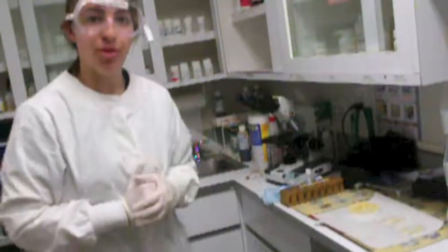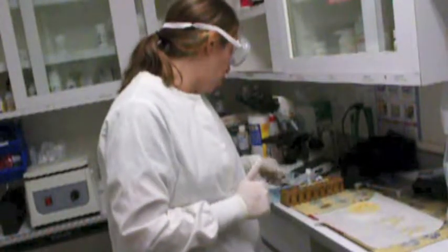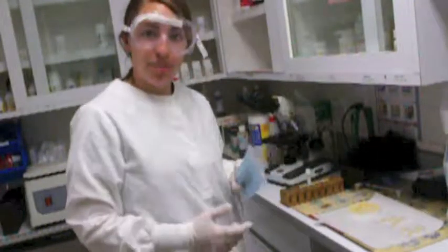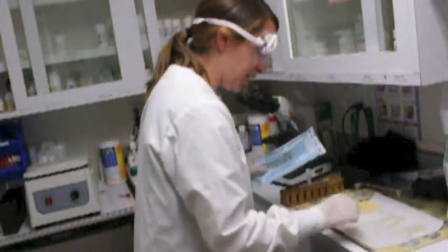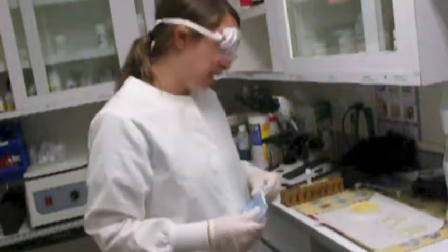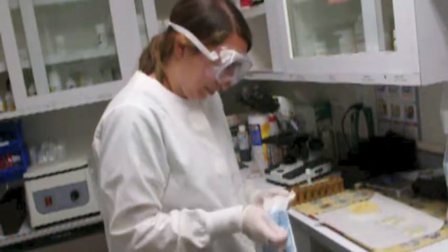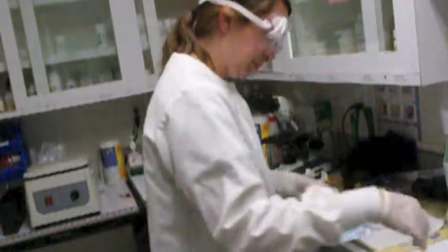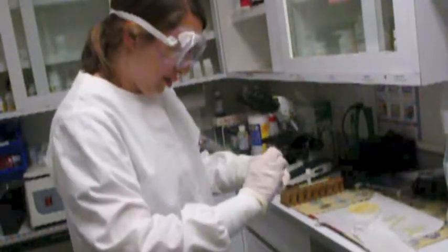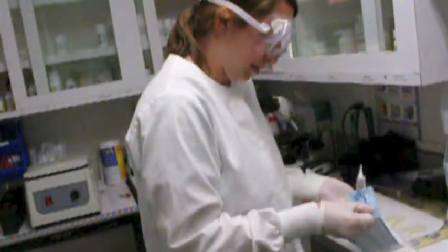Okay, so next what I'm going to do is add my antibacterial disc to the areas with growth. So first I'm going to use my sterile hemostats. I have my antibacterial discs here. So I have penicillin, chloramphenicol, amoxicillin, and cephalexin as my samples. So I'm just going to open this up. And again, you don't want to contaminate the sample. And keep it as clean as possible.